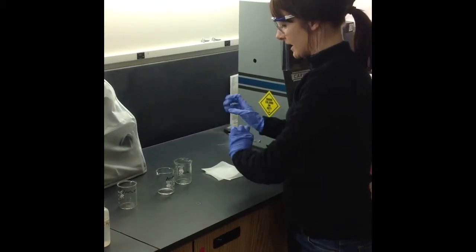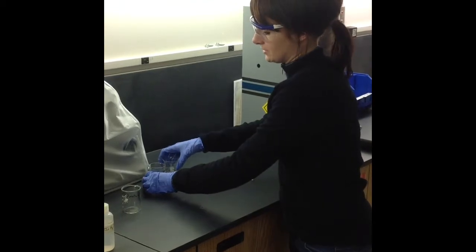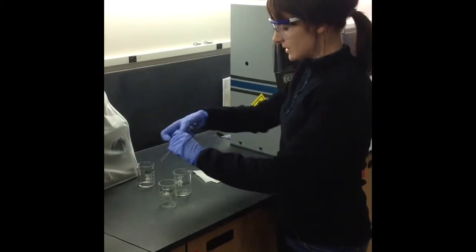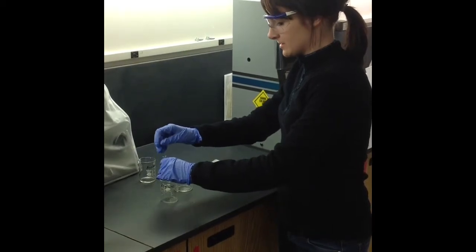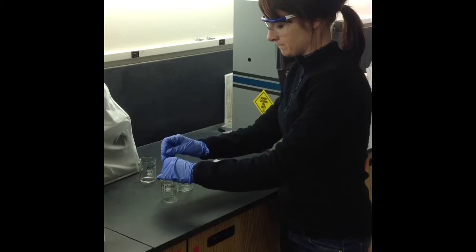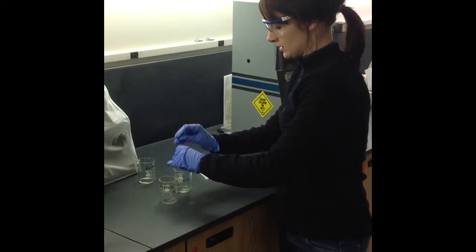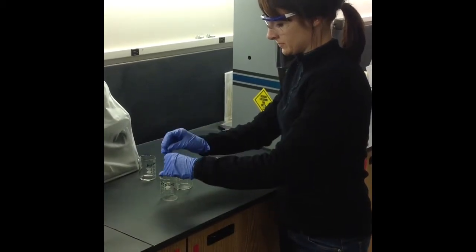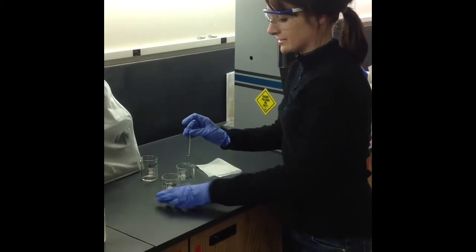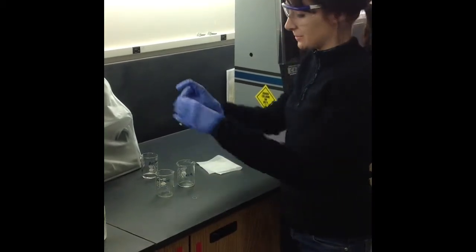And then once that is done, I can take my sample and do the same thing for a total of three times.